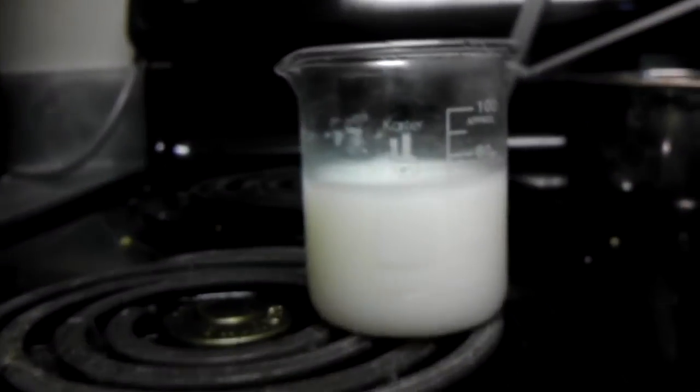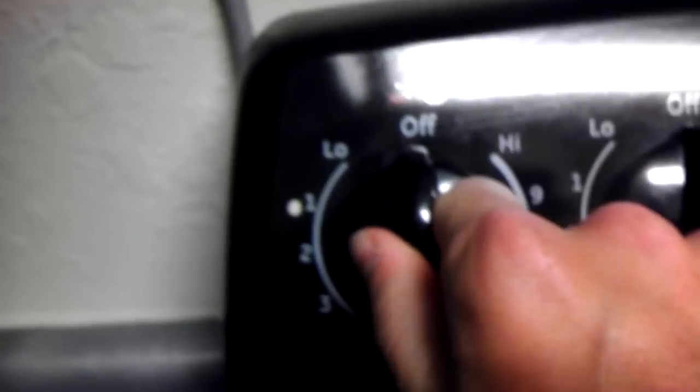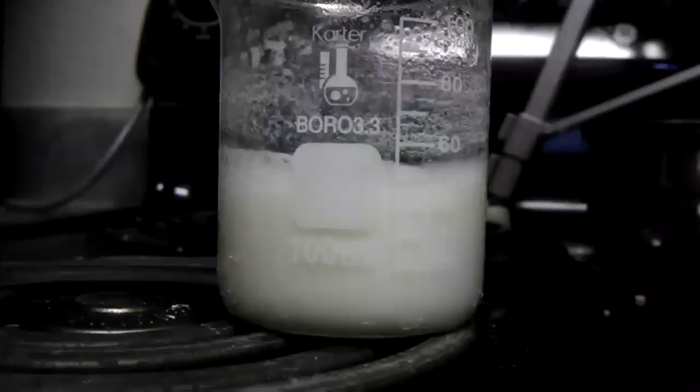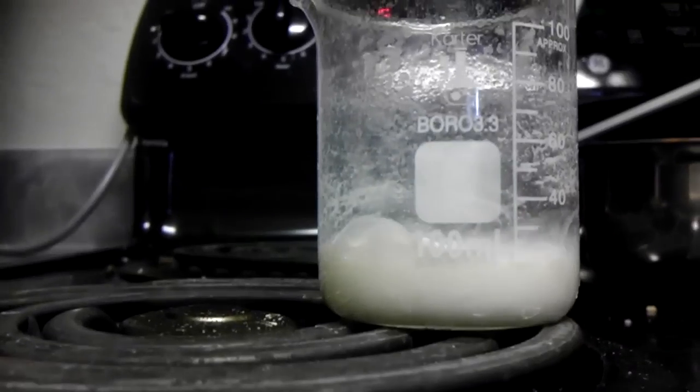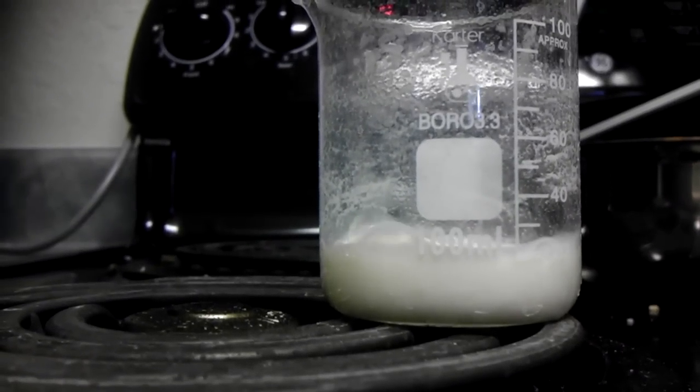After your two hours, place it on the stove, and turn it on low to evaporate off the acetone. Keep going. Okay, and there we go.